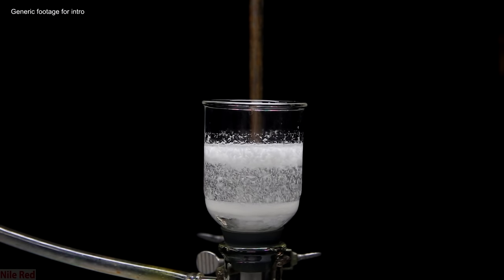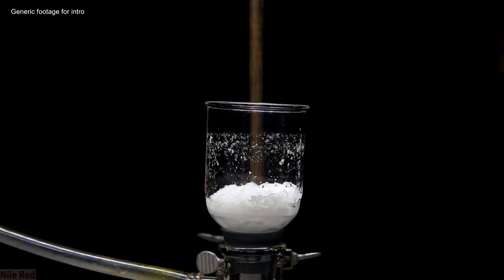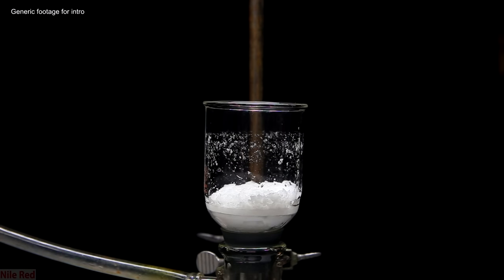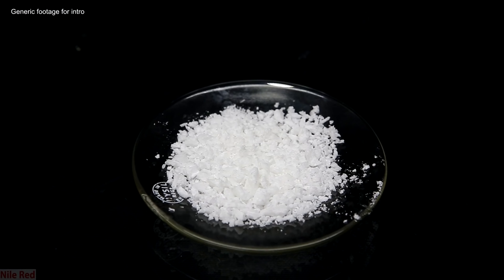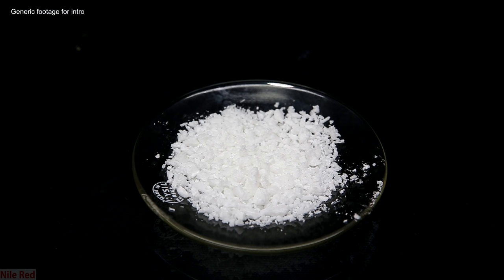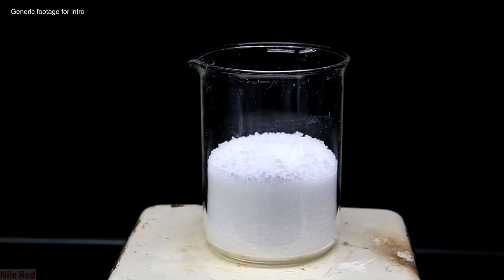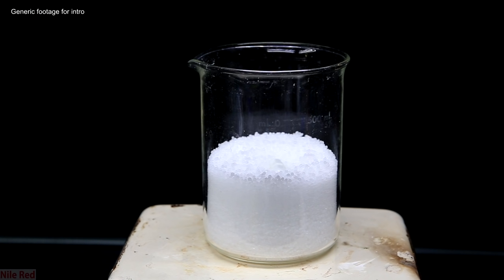When it's done hot, it's usually because the solubility at room temperature isn't good enough to dissolve everything in a reasonable amount of solvent. The technique is pretty much the same, though, and everything's dissolved in very hot solvent A. Then, solvent B is added very slowly and drop-wise until we see just a little bit of our compound of interest precipitate out. We then add a little bit of hot solvent A to redissolve everything and get it back into solution, and then we take it off heat and let it recrystallize as normal.